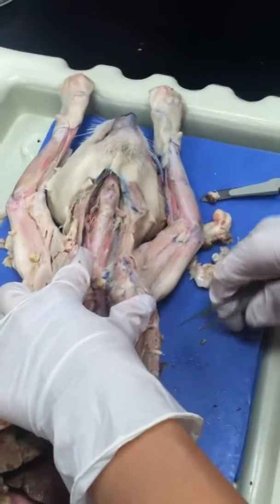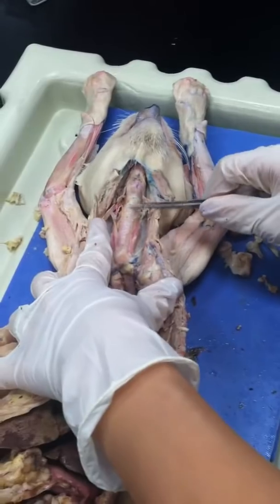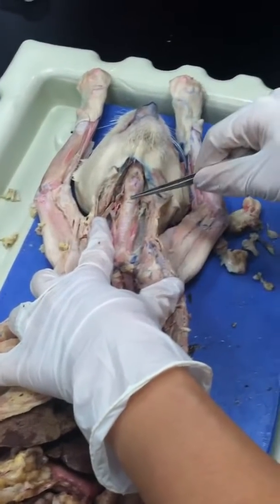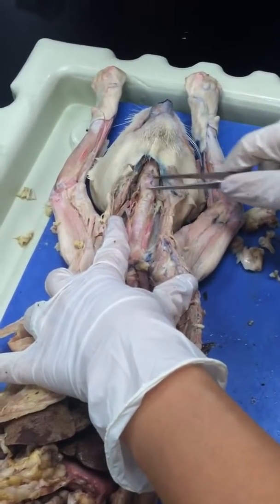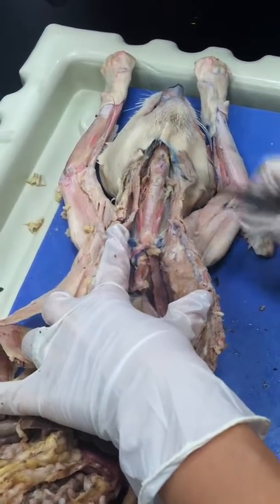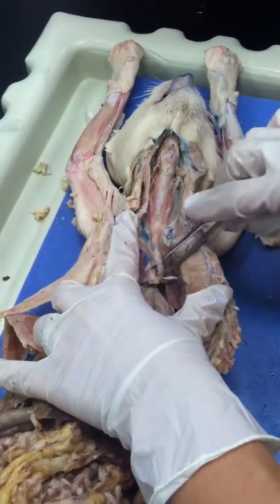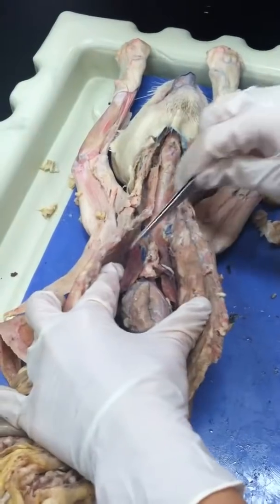Go ahead. You're on. You start with the trachea, high up like this. The thyroid cartilage is on top of it, this one. And then the trachea divides into two bronchi, one on each side for each lung, like that. The two lungs, many lobes.